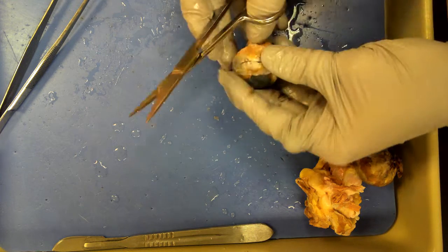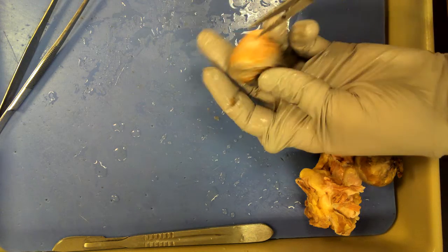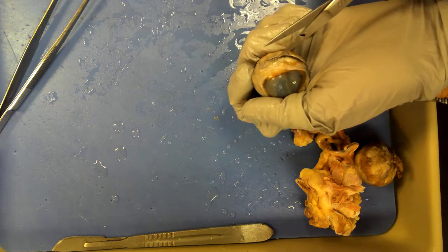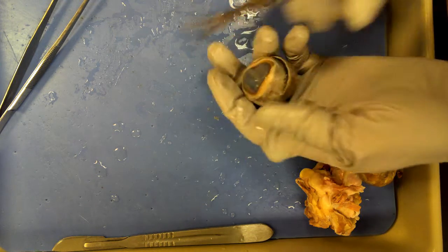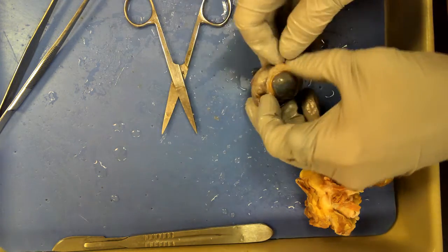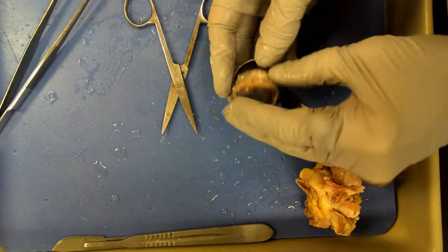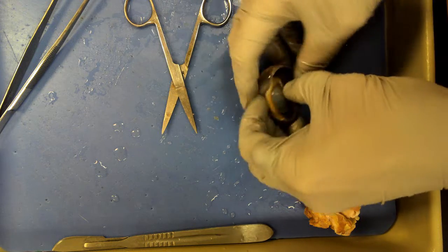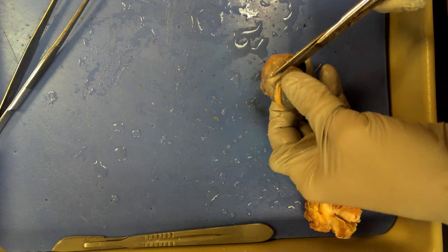You want the eye to be as dark as possible in most cases. In the case of the sheep, it's going to have a streak of beautiful, brilliant blue so that it can see in the dark a little bit better.